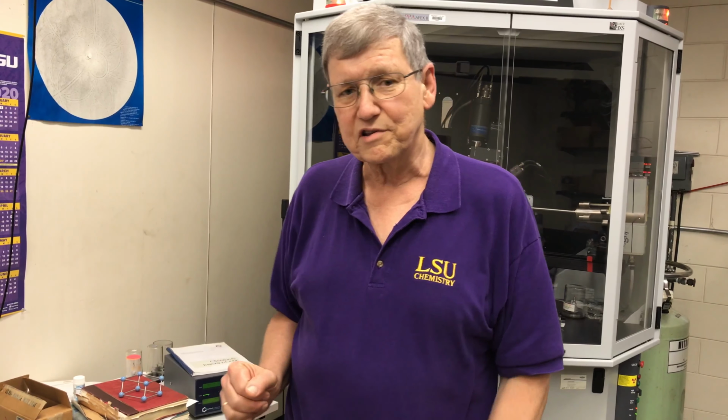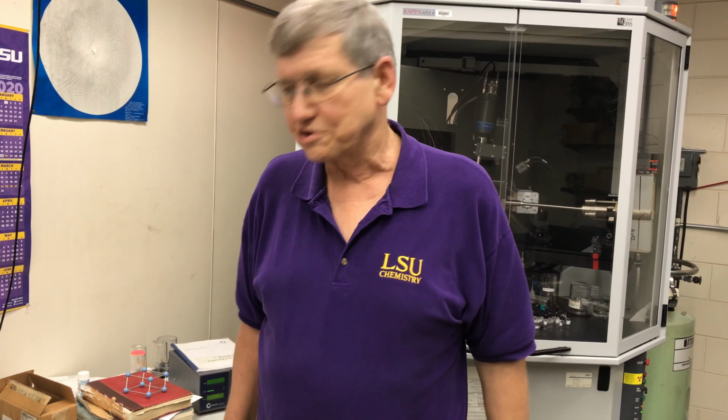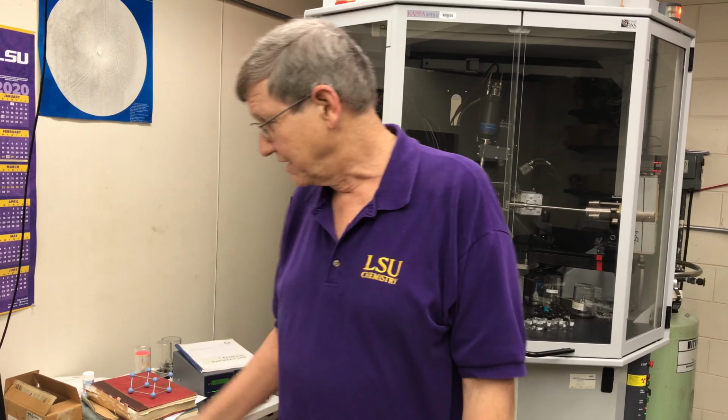And of course, the size of the peak depends on how many electrons there are in the atom. A cobalt atom will have a much bigger peak than a carbon atom will, for instance. So we can find the three-dimensional coordinates of all the atoms within the unit cell, and we can see which ones are close enough together to have covalent bonds between them. And we can come up with a mathematical model of the molecule which is packed into making up the crystal.